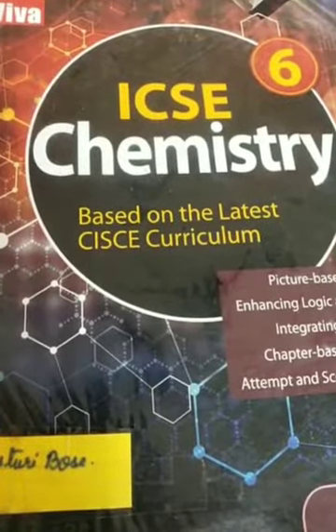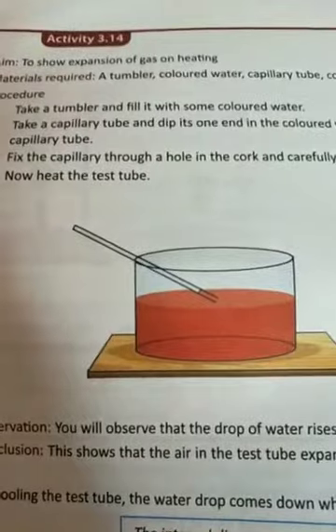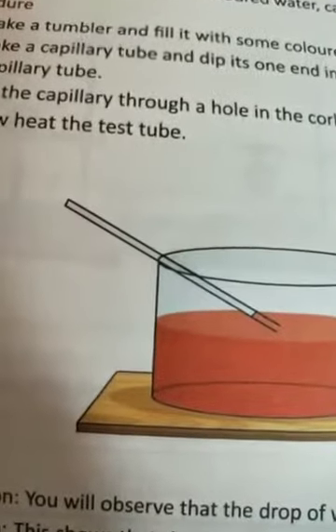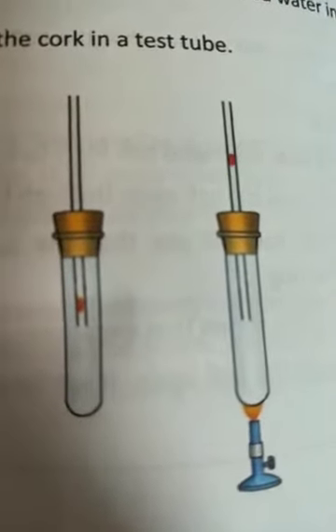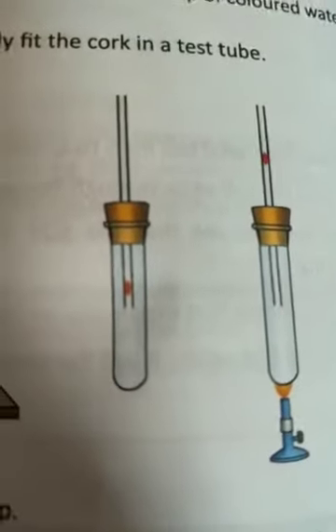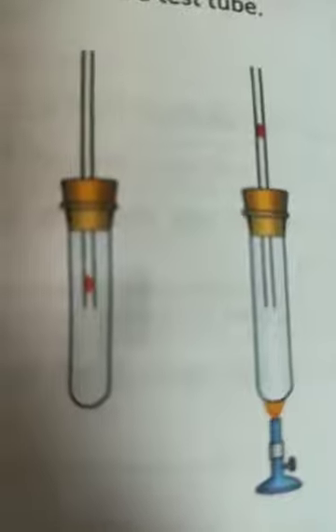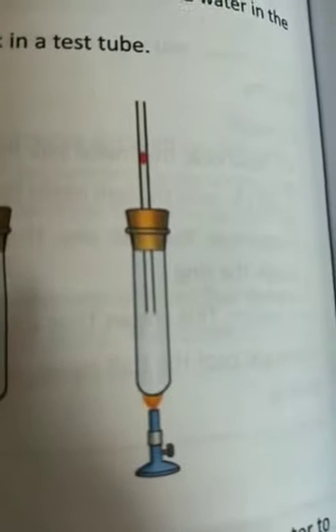Good morning students. Let's start the last topic of this chapter — Activity 3.14 from your book. In this activity, we are showing the expansion of gases on heating. If you take a capillary tube, take one droplet of a colored liquid and put it in the tube, then heat the test tube, you will find that the drop of liquid moves towards the exterior end — upwards in the capillary tube. This rising of the water drop shows that the air inside the empty test tube expands on heating, and that is why it pushes the drop of water upwards in the tube.